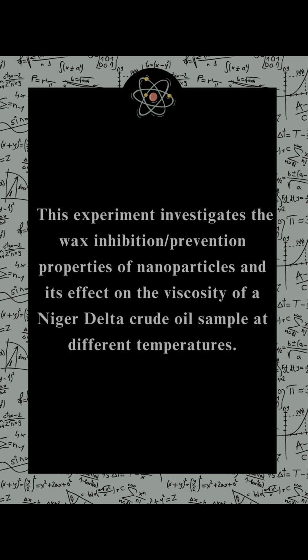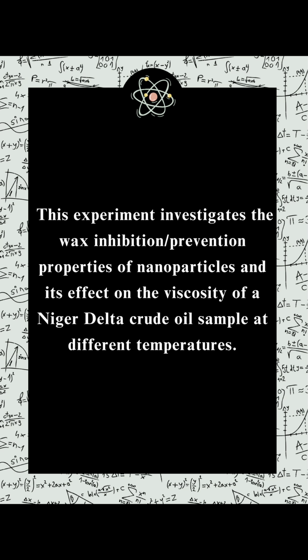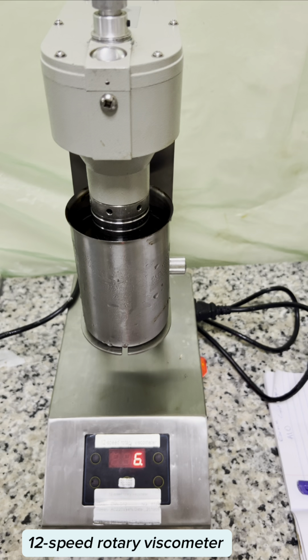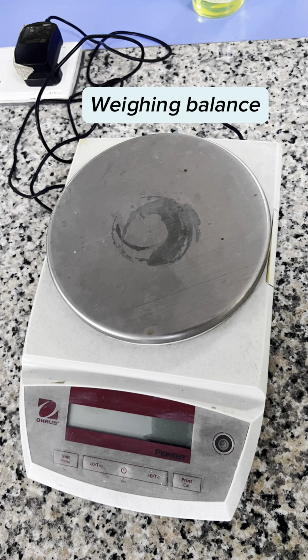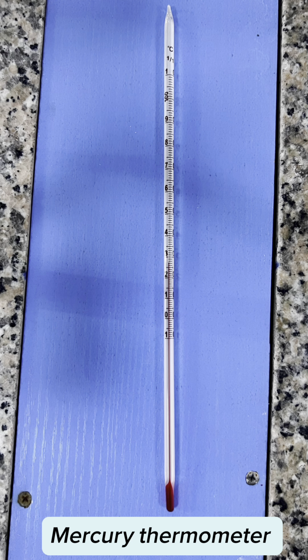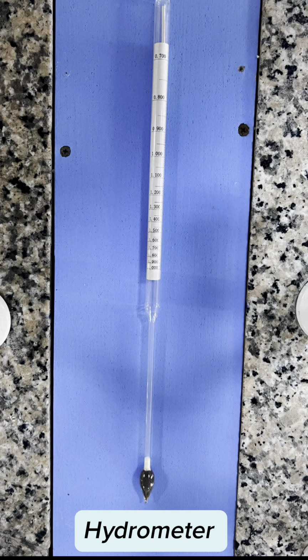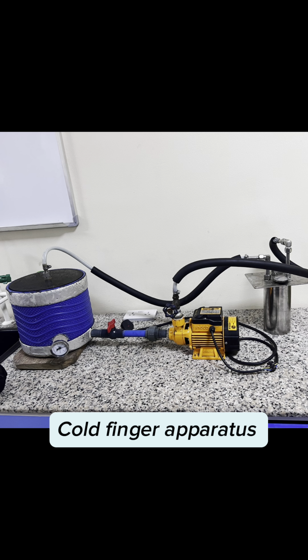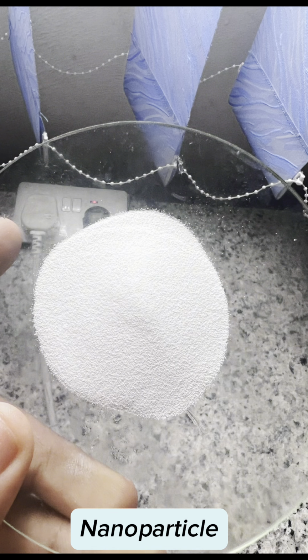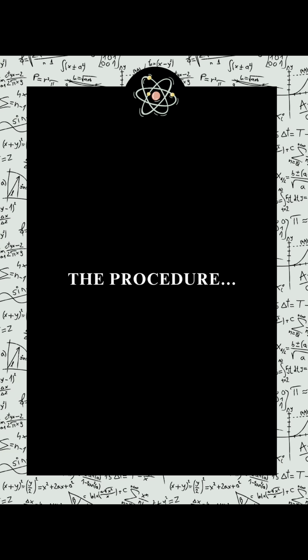This experiment investigates the wax inhibition properties of a nanoparticle and its effect on the viscosity of a Niger Delta crude oil sample at different temperatures. The experiment was done using the following materials and apparatus: a 12-speed rotary viscometer, a weighing balance, an electric mixer, a measuring cylinder, a mercury thermometer, a watch glass, a hydrometer, a cold finger apparatus, ice, a digital water bath, a nanoparticle, and a timer.